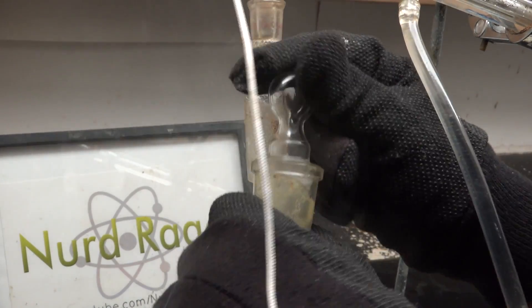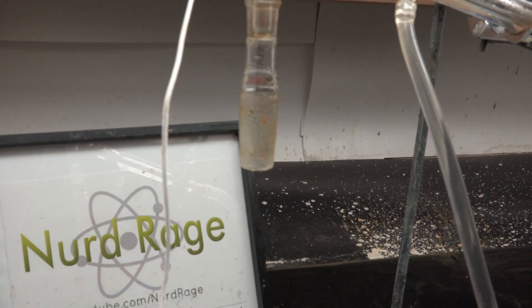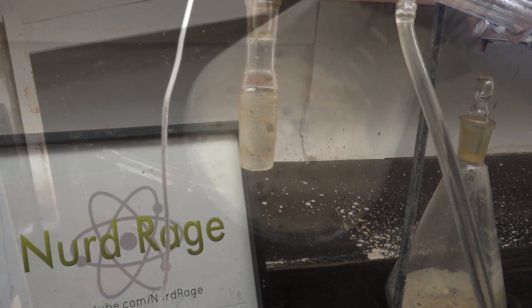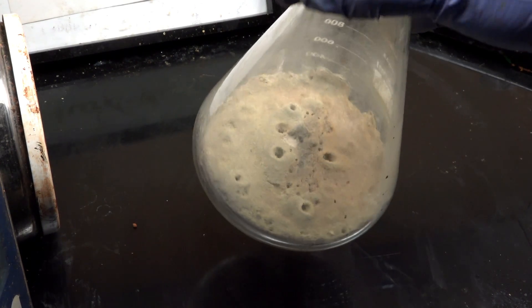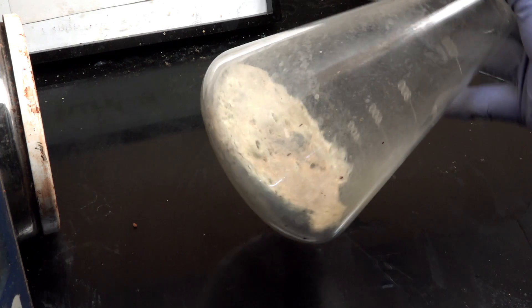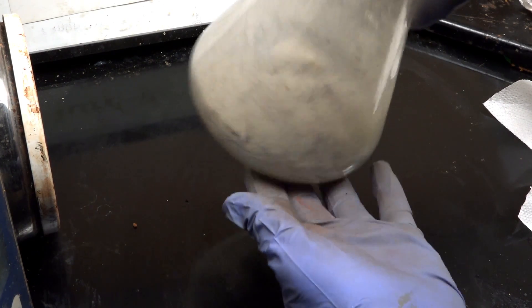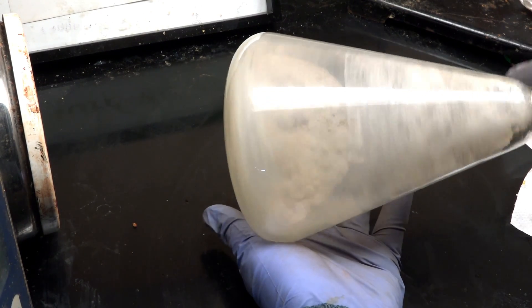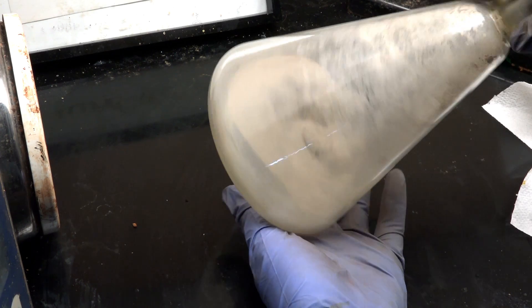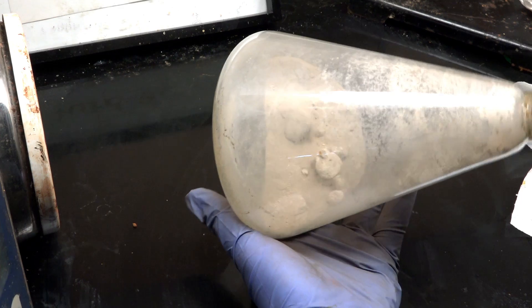As the ferrous chloride starts drying, you may want to wrap your flask in foil to keep the heat in and prevent condensation from remaining in the flask at the end. Turn the heating to maximum and let the ferrous chloride thoroughly dry. Then, while the flask is still hot, quickly disconnect it from the stillhead and stopper it. Unfortunately a tiny amount of air will get in but this is unavoidable. Now let it cool at room temperature. And there we have our anhydrous ferrous chloride. You can see a very light shade of red on the surface due to the air getting in, but this is minor. The cake is quite fragile and some hard shaking will break it up into chunks that are much cleaner and more uniform than the air-dried ferrous chloride shown earlier. I recommend keeping the ferrous chloride stoppered in the flask to prevent air getting in, and only opening it when you need it. While the nails are still in there, leave them — just remember to remove them when you retrieve the ferrous chloride.